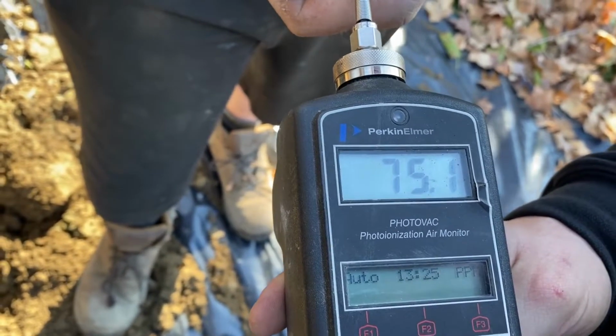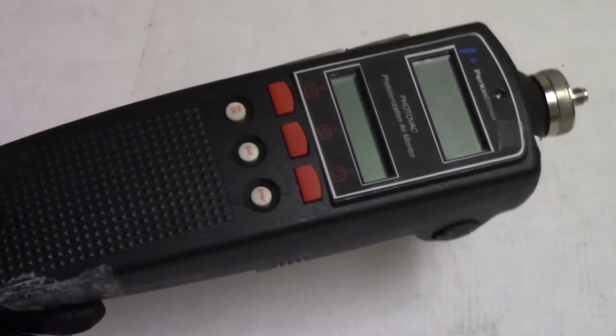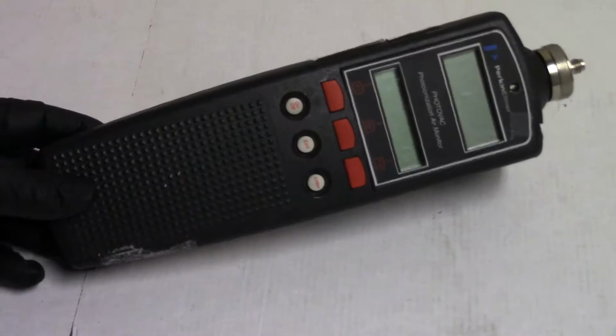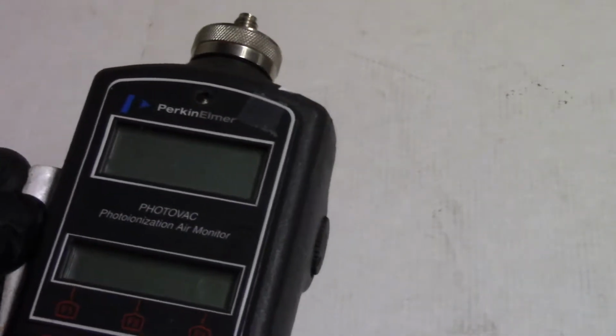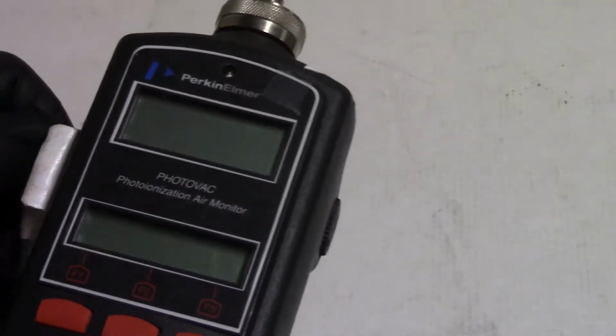Looks like 80 is our highest, so not that bad. This should actually be the same model that they use, or at least one of them. It's made by PerkinElmer. This particular device was made in, I think, 1998. I'll be curious to see what sort of guts it has.